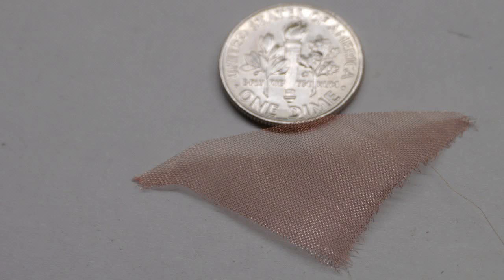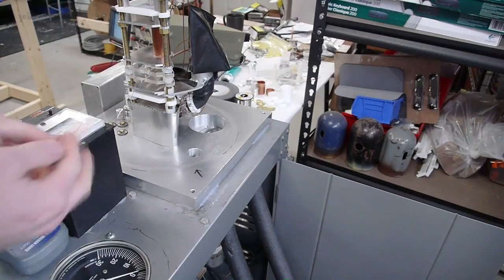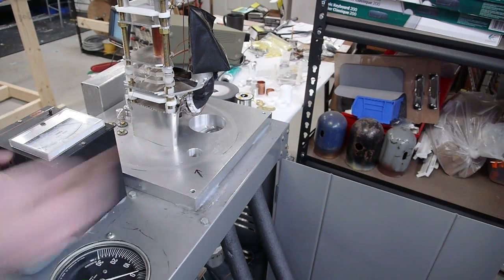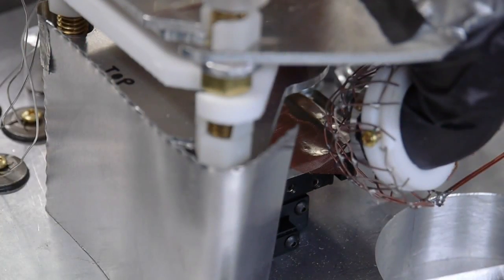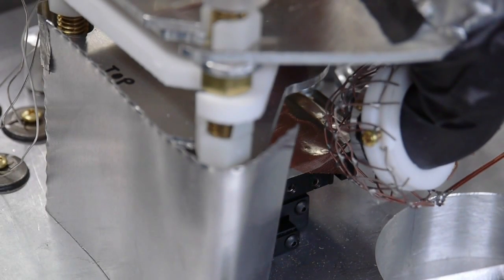It's a very fine screen and the sample goes inside here. So I already have it loaded in so let me just zoom in there so you can see it. There's that copper mesh that's sitting on the platform inside there and that's where the sample is.